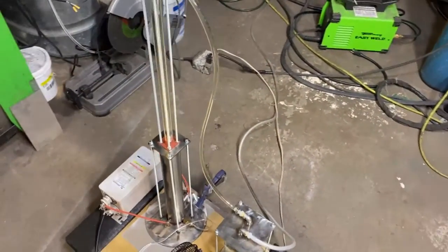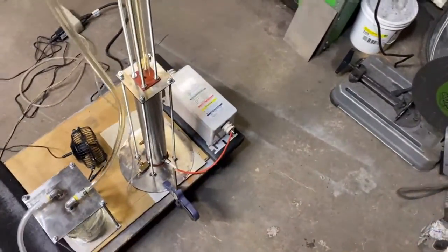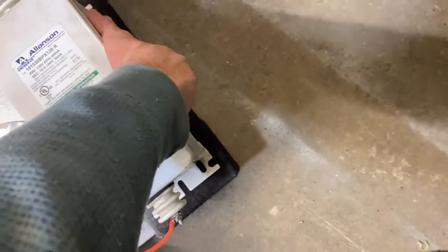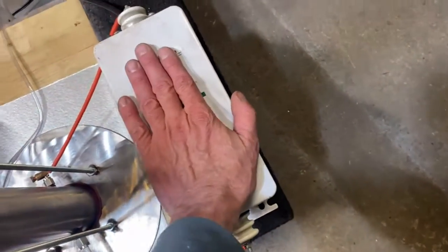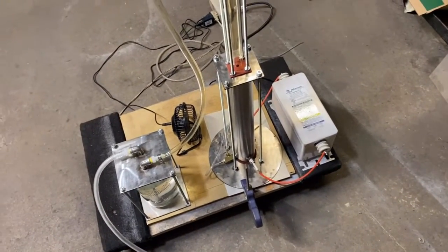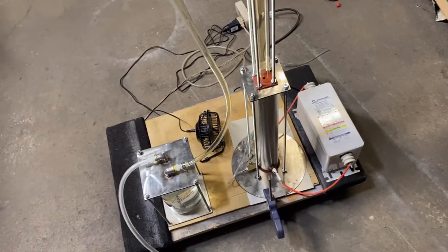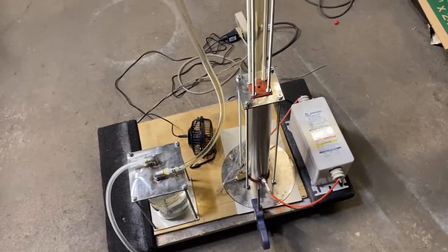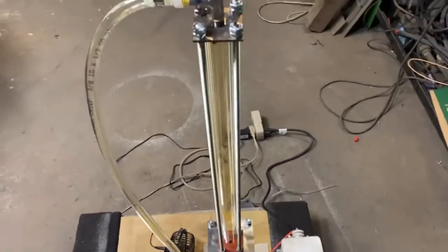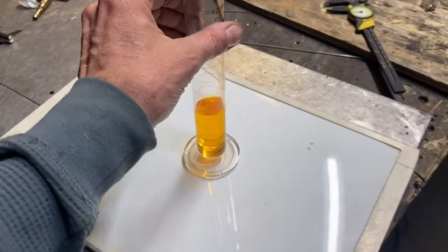I'm making a rough guess on 25 watts actually making it into the process. That transformer is very hot to the touch — I've got a little fan sitting on it now. It's got to be every bit of 50 watts of heat coming off of that, maybe another 50 watts there. So I'm thinking maybe only 25 watts is going to the chemical conversion — and if that's the case, I may not be that lucky.